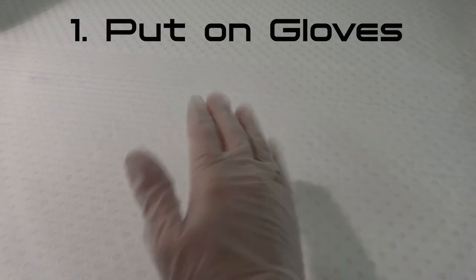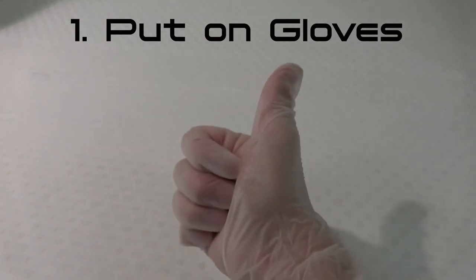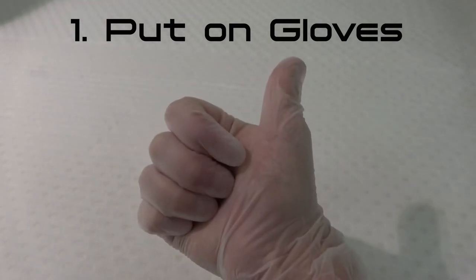Preparation Method. Step 1: Put on gloves. Always keep fingerprints off anything that will go into the SEM chamber, such as stubs and samples.